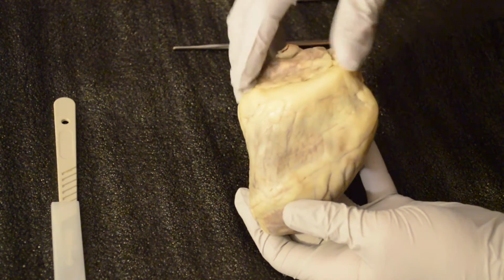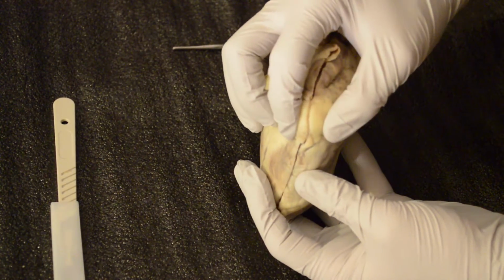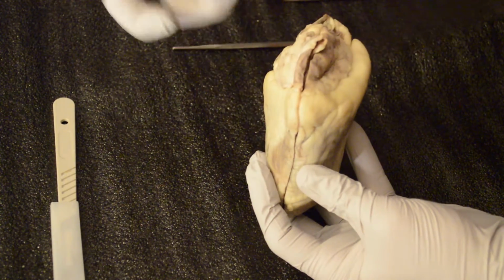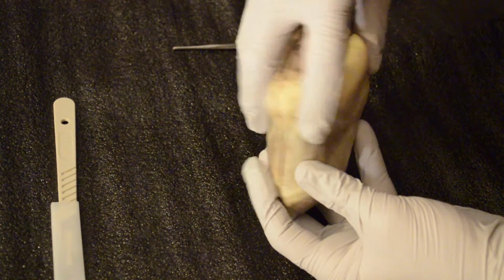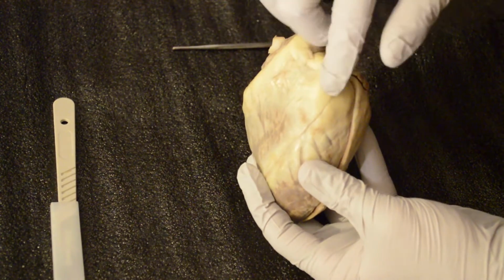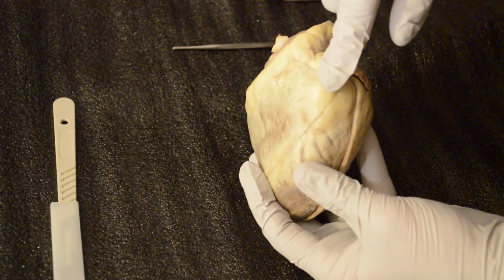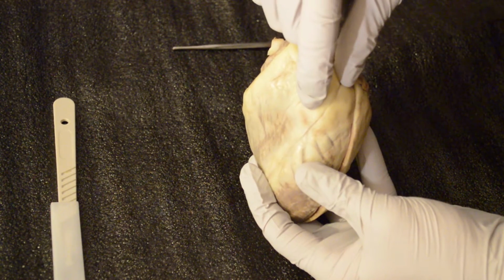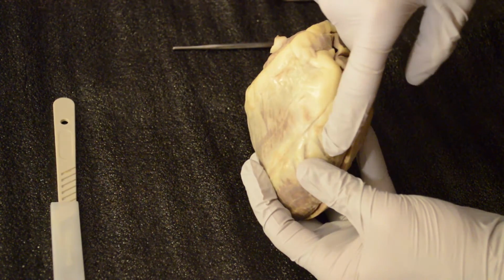Okay. Next, we'll move into the right and left auricles. The right auricle is this little cone-shaped muscle here. It's right on top of the right atrium, and it collects primarily deoxygenated blood. This is also called the right atrial appendage. On the converse, this is the left atrial appendage, or the left auricle on this side. This is also a small muscular pouch, if you will, at the upper left-hand corner of the atrium. It collects the oxygenated blood from the lungs, and it moves to and through the atrium to the left ventricle.